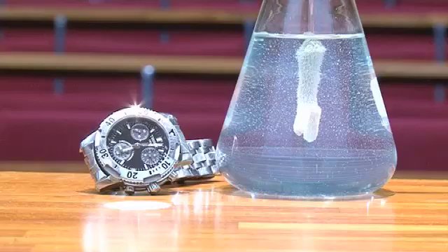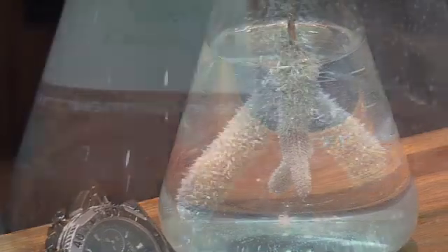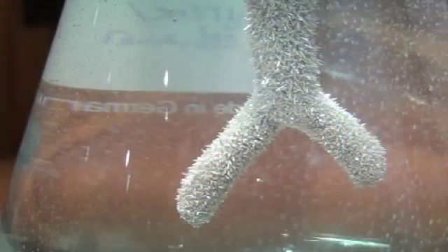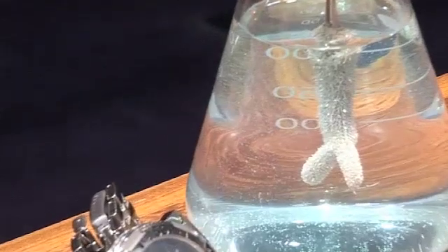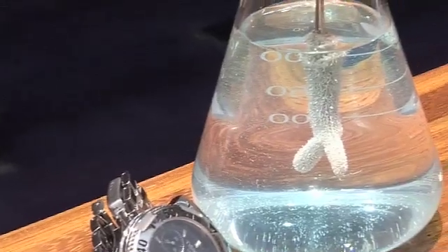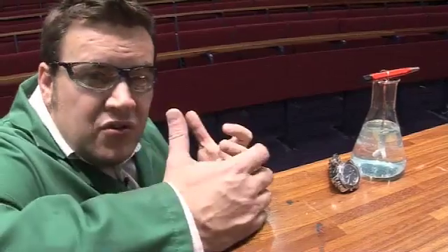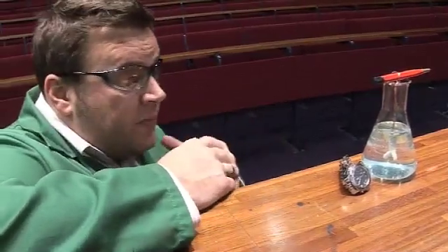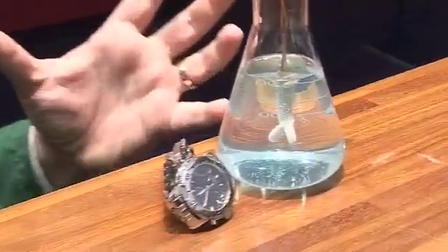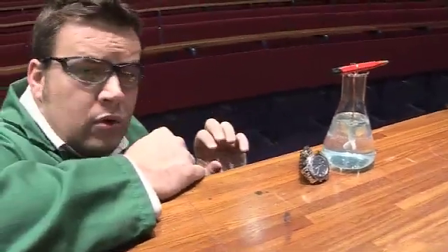There have been big changes in our flask. If you look carefully, you can see that the copper wire itself is now covered in very, very sharp crystals of silver, which have basically become deposited on the surface. Copper has won this chemical reaction — it's going into solution, taking the salt element and precipitating solid silver crystals. The colour of the solution has also changed: it was colourless before, and now it's blue, which tells us there are copper ions in solution.